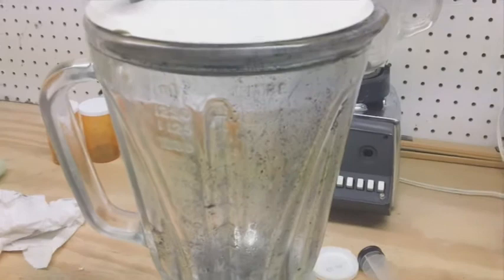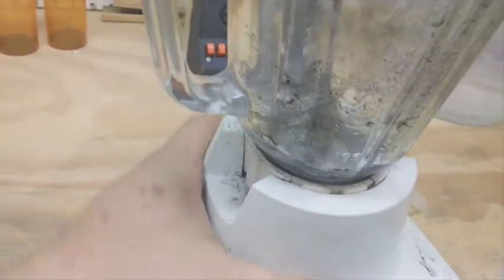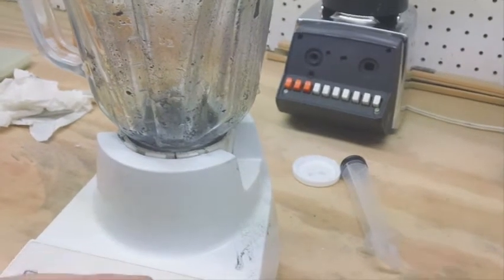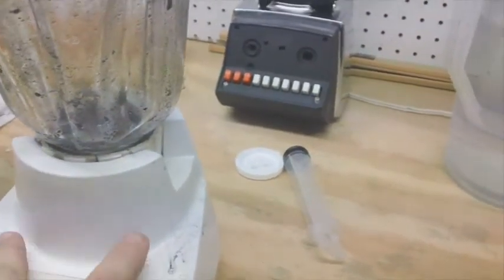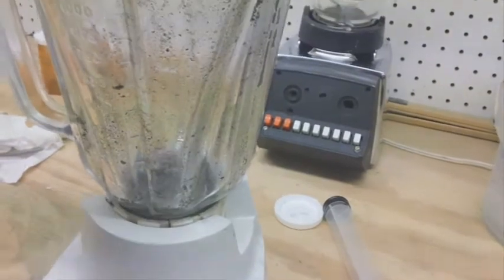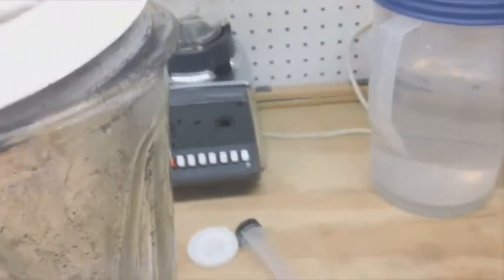The acetone smell is definitely present, but the blender itself, after running for an hour, was barely warm — it's not really chopping anything heavy duty. I do have some concerns about the blender itself because it's made of plastic. As you may know from 3D printing, acetone will melt certain kinds of plastic. I picked two of these blenders up for $10 at the Goodwill store, but the base down inside is made of plastic, so I'm not really sure how long it's going to last or if it's going to affect the process.